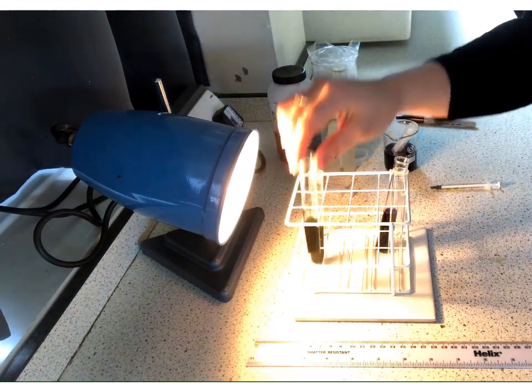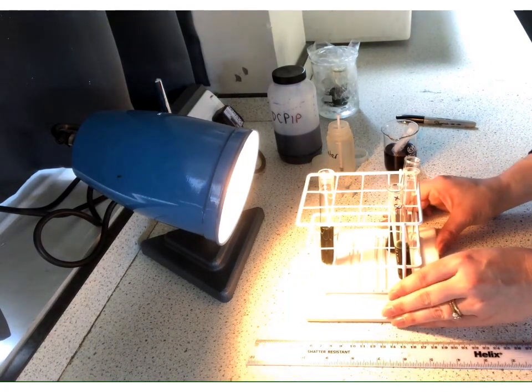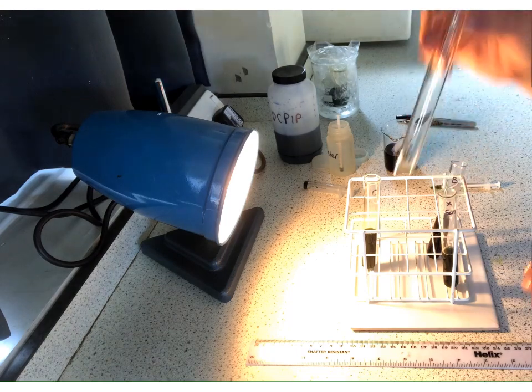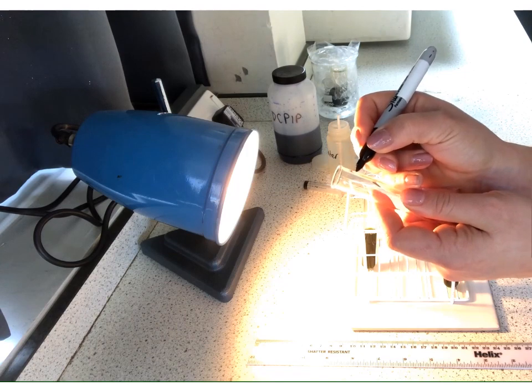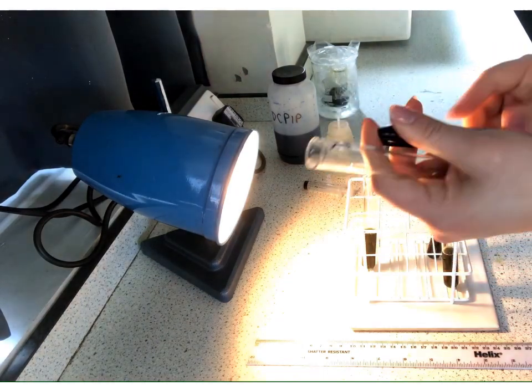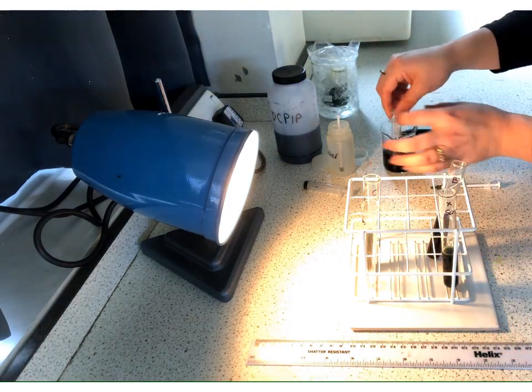So that's our 5. Okay, so now we're going to try it at 10. Using the ruler, we need to take it backwards to about, I've marked this all on the desk. I'm going to keep my control there for comparison purposes, and this is going to be my second investigation. So this is going to be 10 centimetres. This should be a lower light intensity, and hopefully means a lower rate of photosynthesis and a slower reaction. So again, we've got our 5.